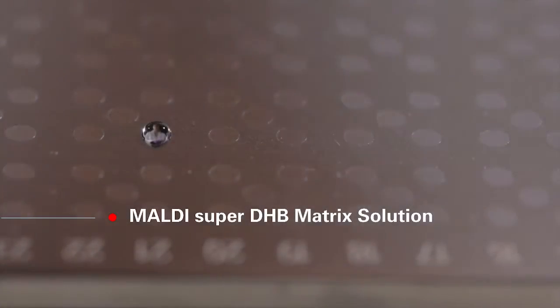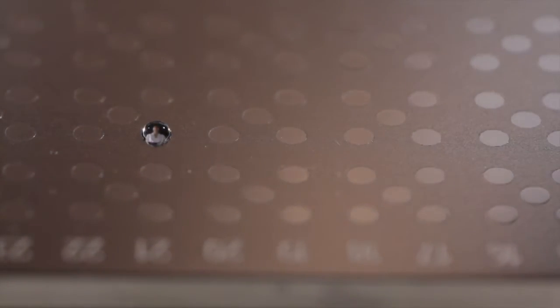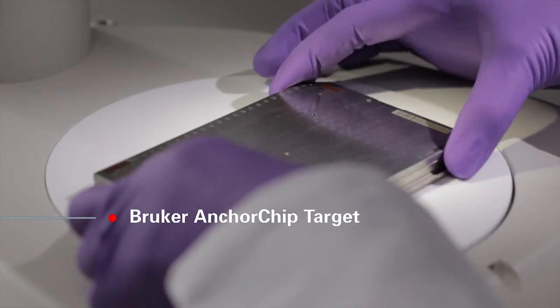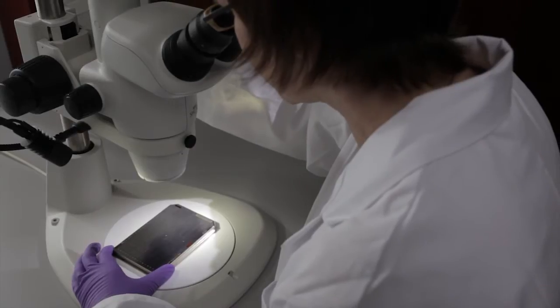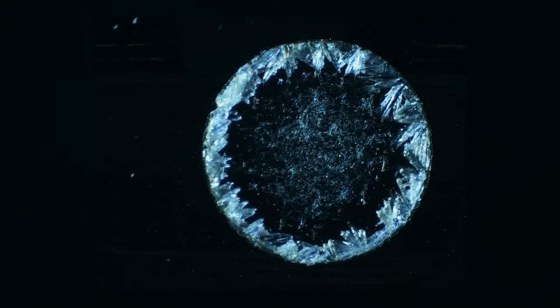Protein mixed with the MALDI matrix solution is deposited on the sample plate in a nominated position. A typical sample amount is 50 picomoles. As the solvent evaporates, super DHB matrix crystals containing the protein form around the rim of the sample position on the Bruker anchor chip plate.